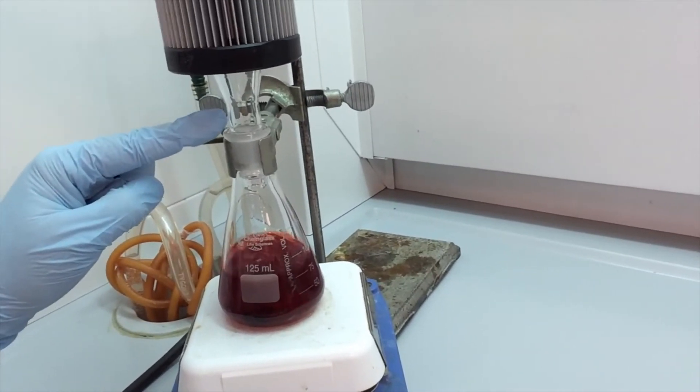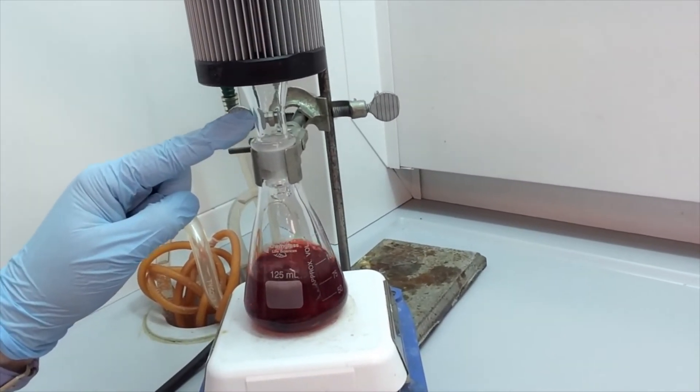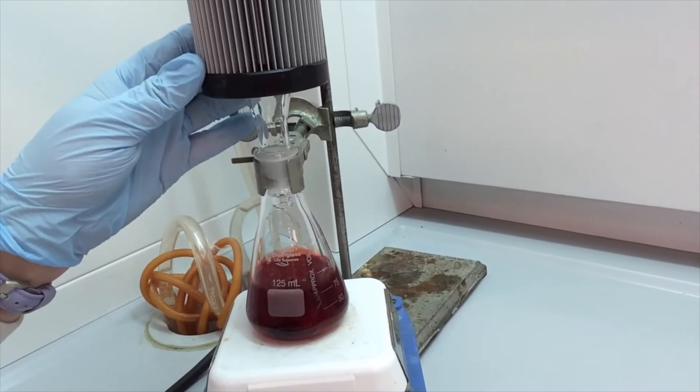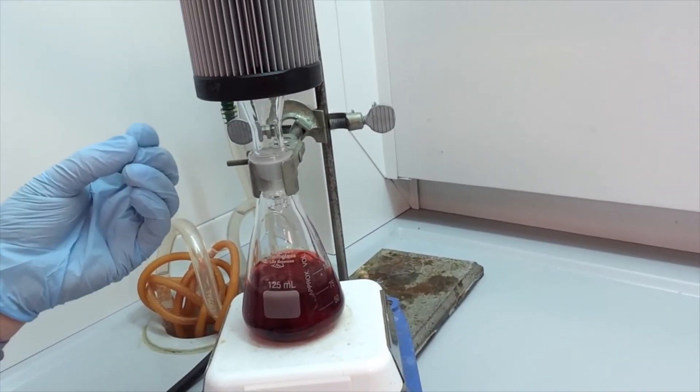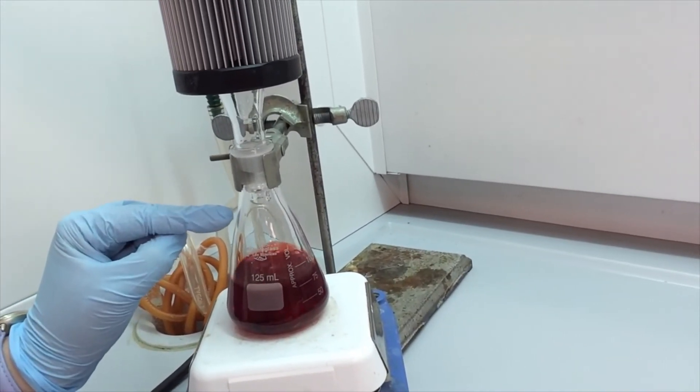We have our wavy reflux line up here. That hot vapor hits the condenser, recondenses into a liquid, and we can see that it's dripping back down.